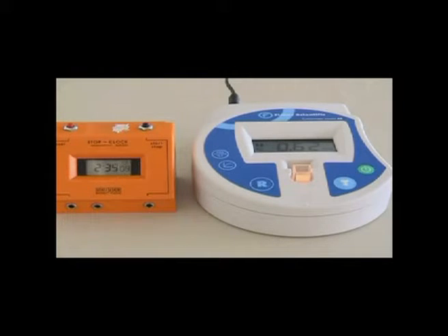The film that you're watching will take you through each of 5 enzyme concentrations, including the one that you're currently looking at, 5%, and then at the end we'll show you the 5 graphs of each of those concentrations, and finally a graph of concentration against initial rate.